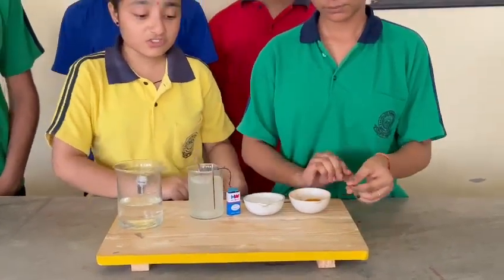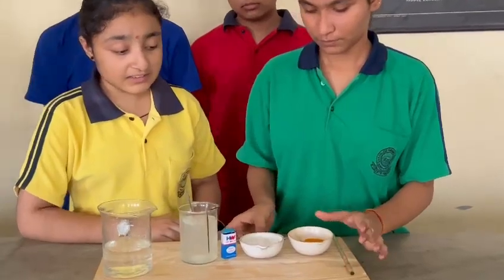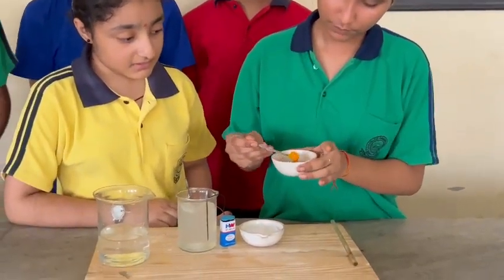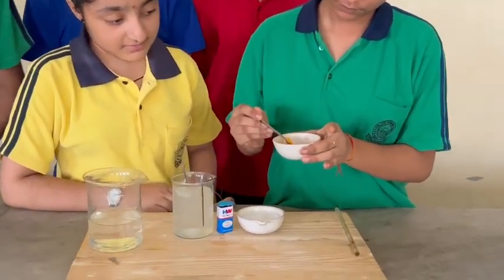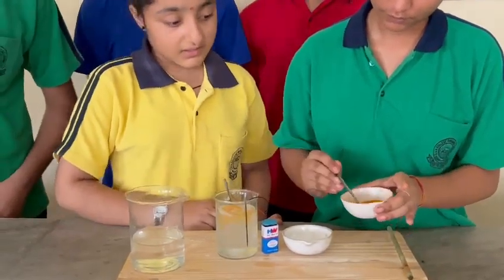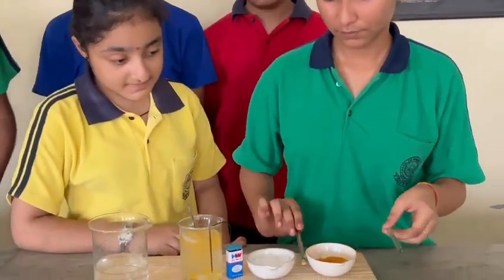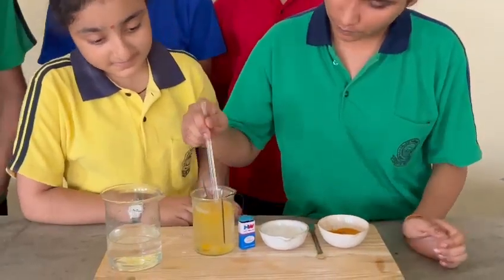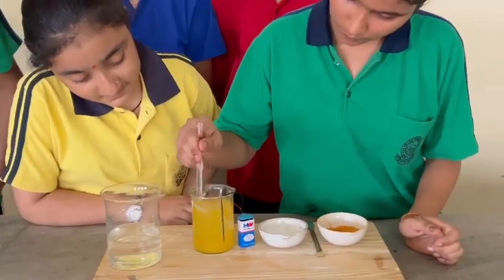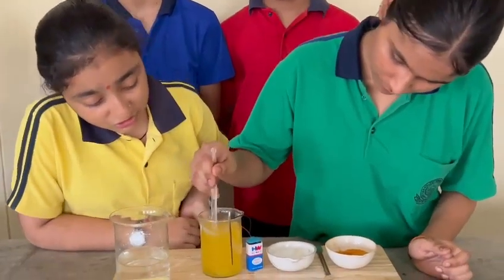Now, to check the nature of the solution, we will put turmeric as an indicator in it and dissolve it completely.